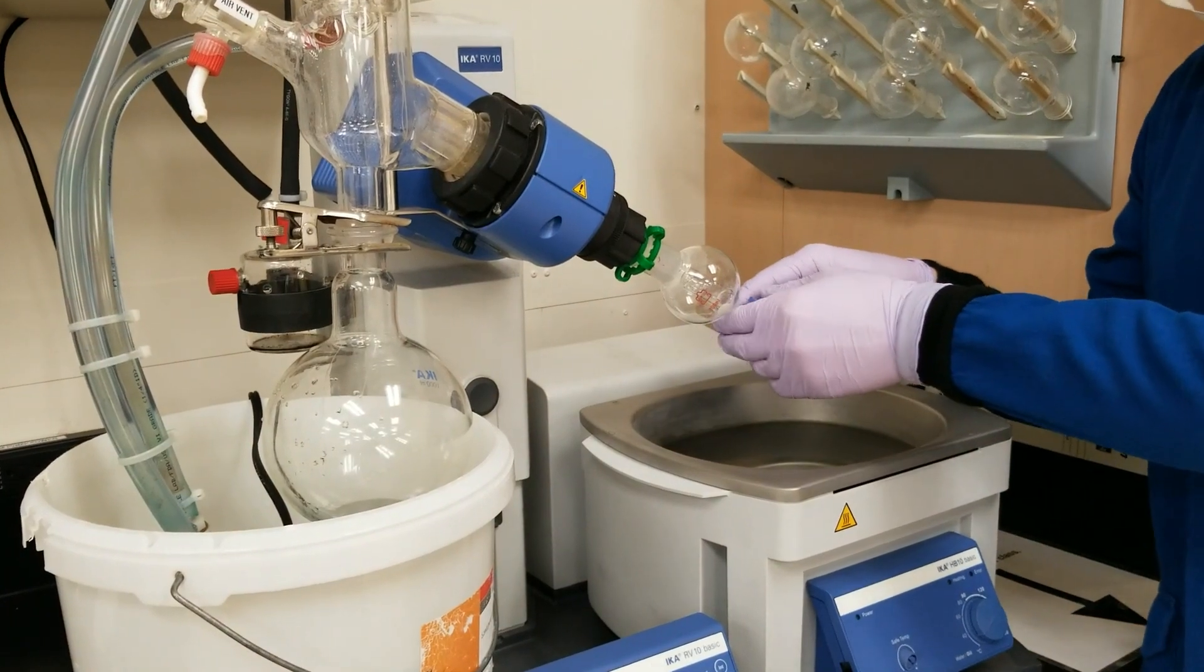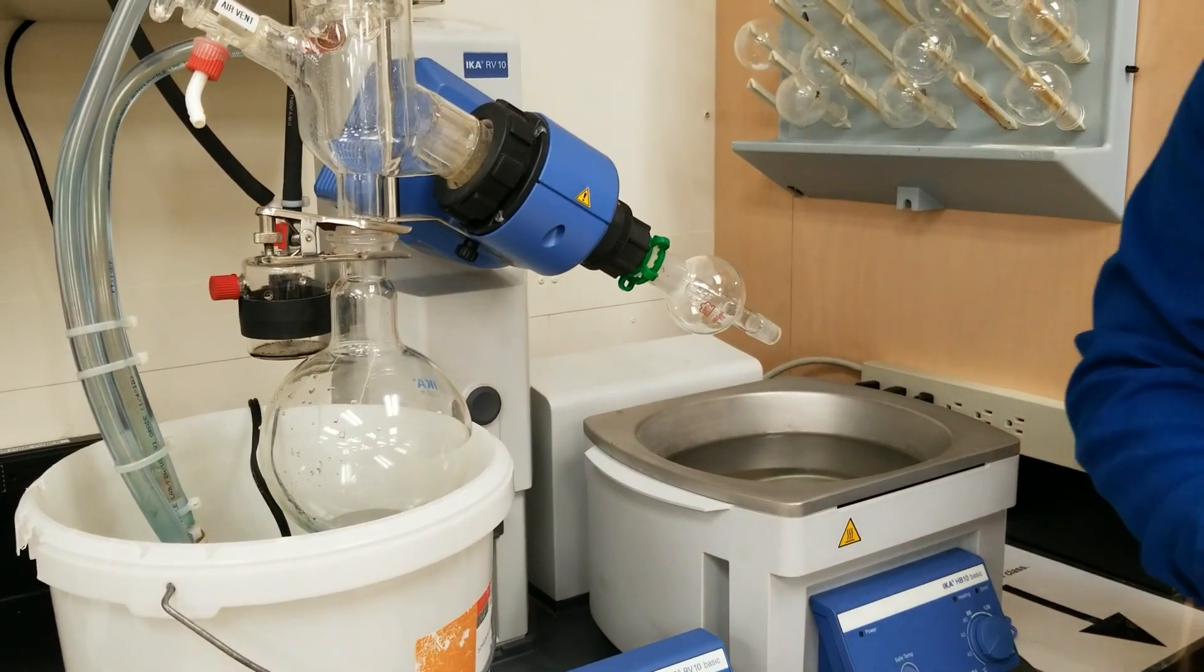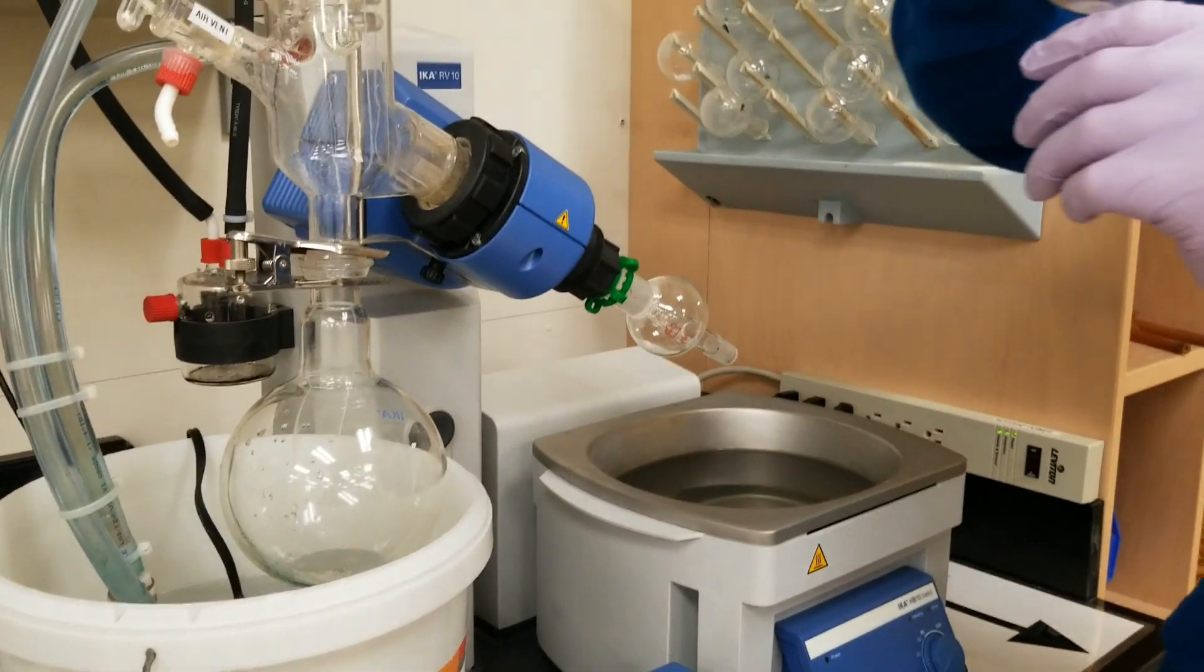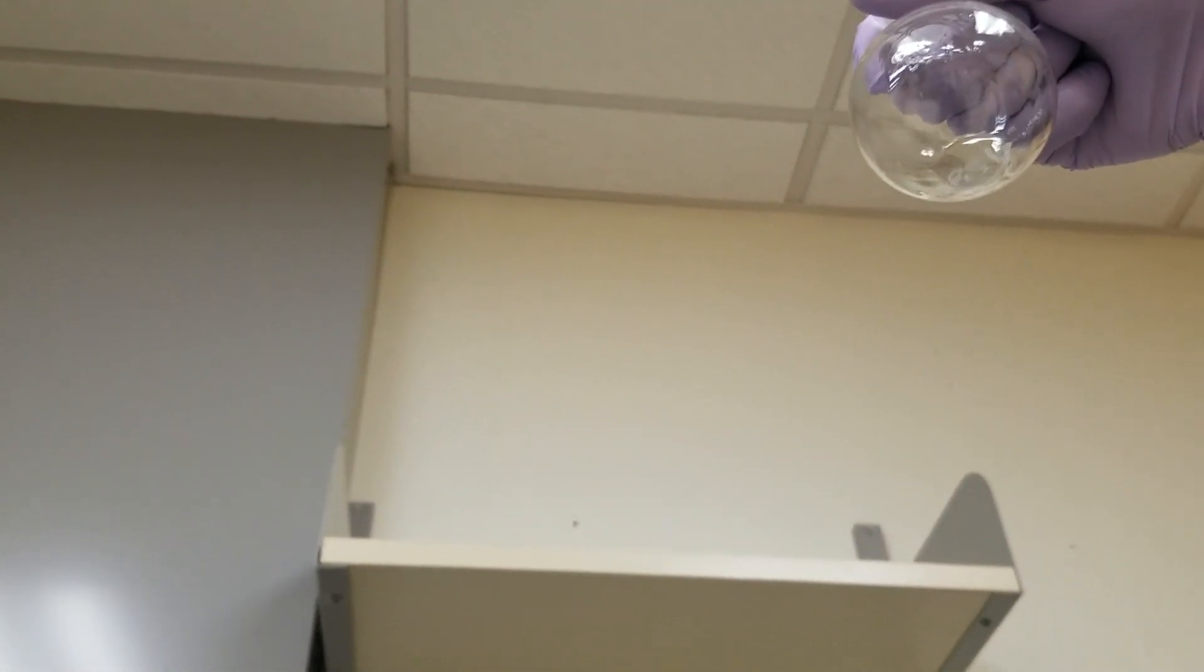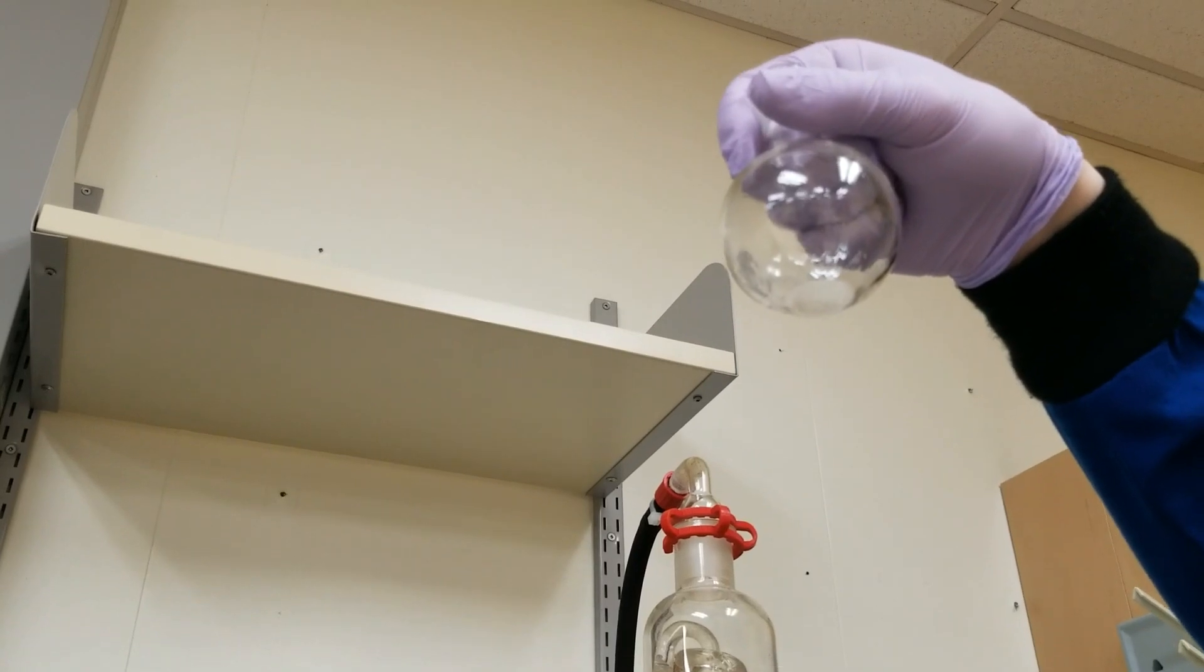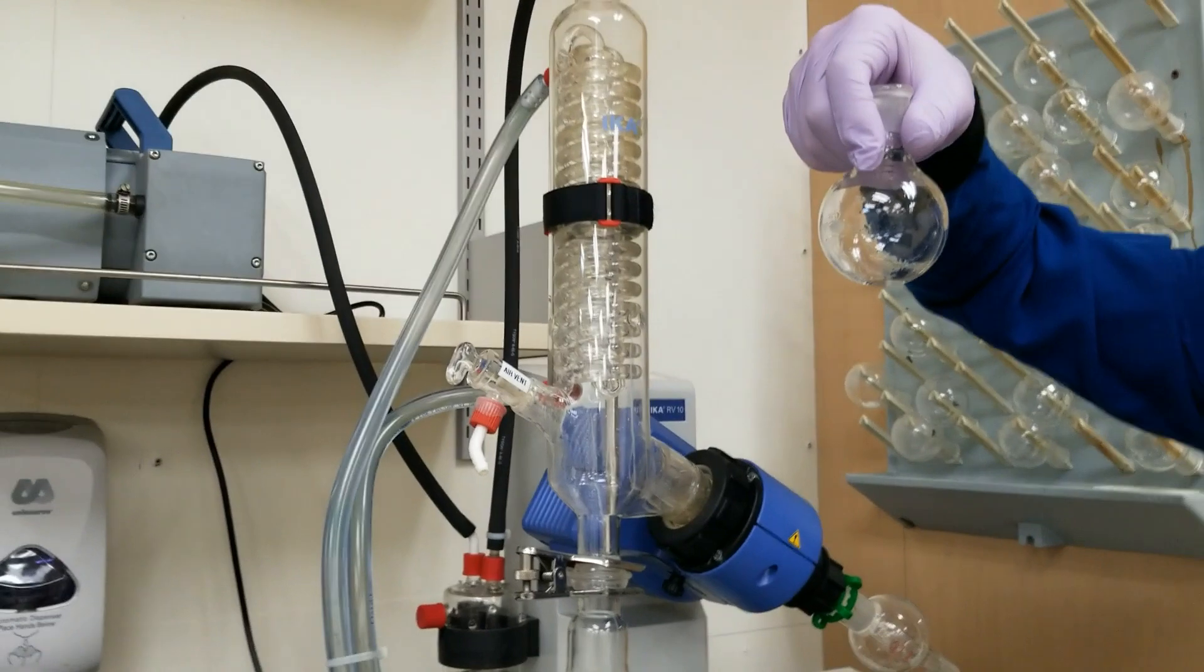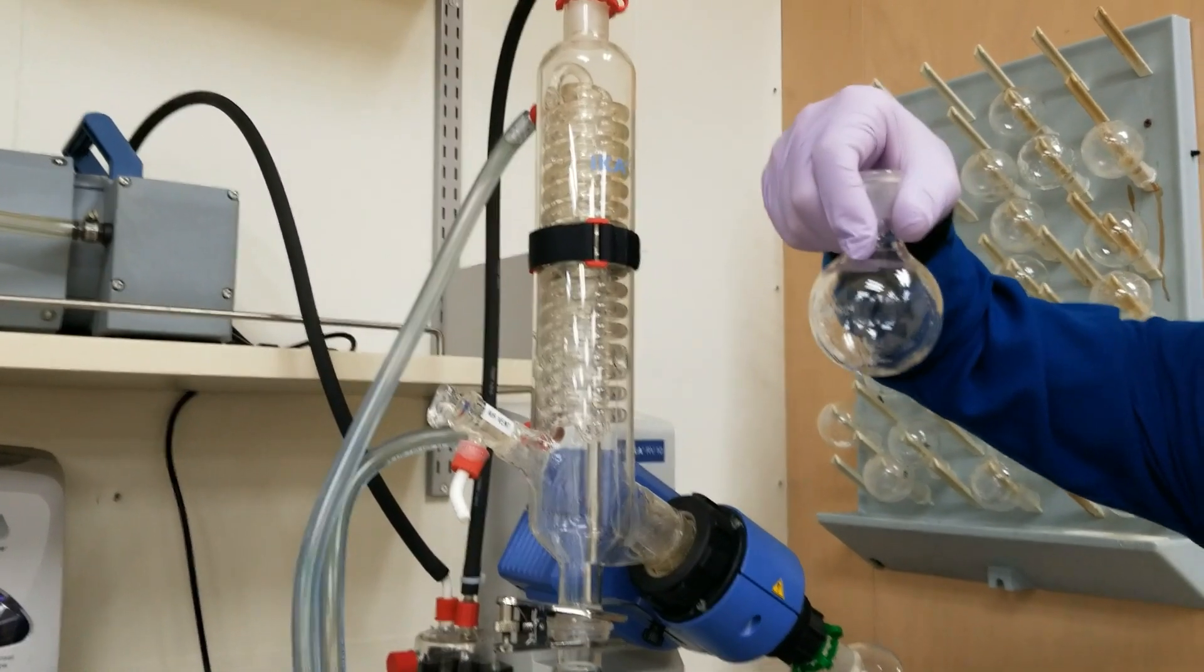I scared myself there, sorry. Let's dry it off really quick. It's just water. I'm not even sure you guys can see that. If you see it from the bottom, you can see just that droplet of liquid which we have collected. And I am going to get a mass and an IR of this. This is our trans-ethylcinnamate product. So I'm going to dry this off better so that the water on the outside of the flask doesn't mess up my weight and go collect that data for you guys.